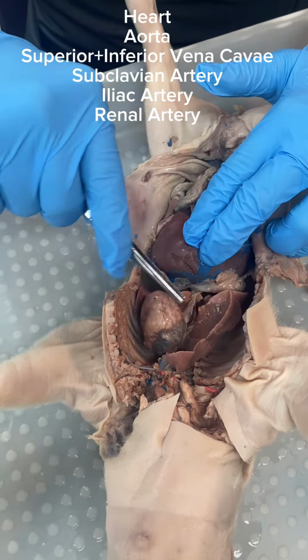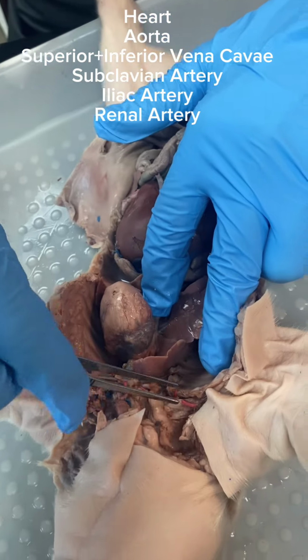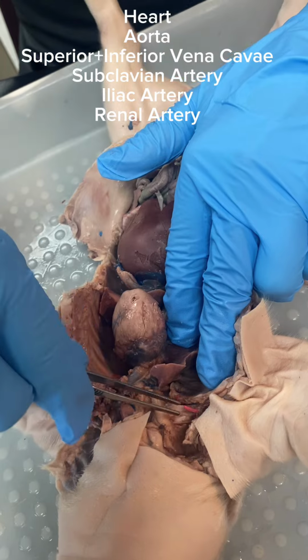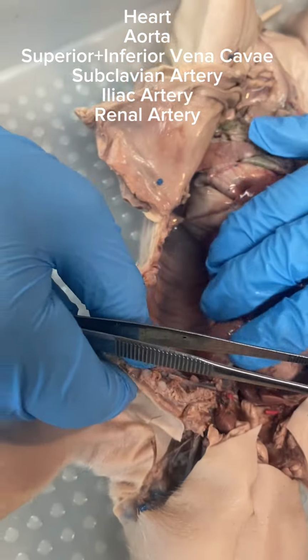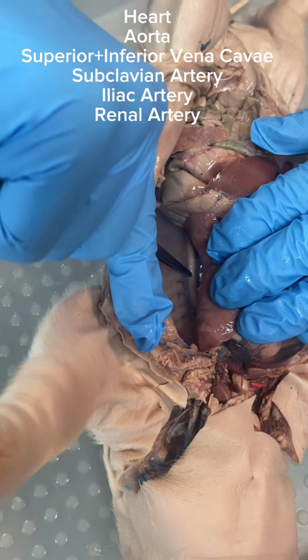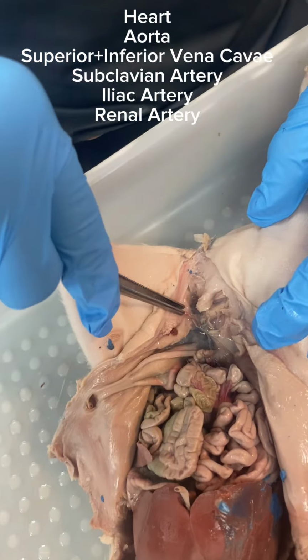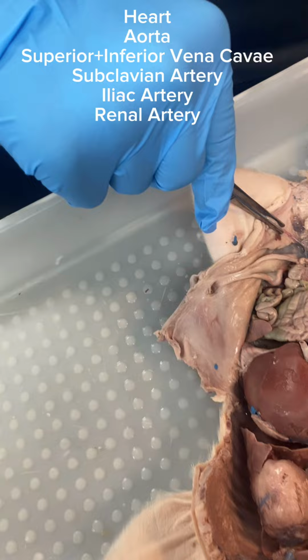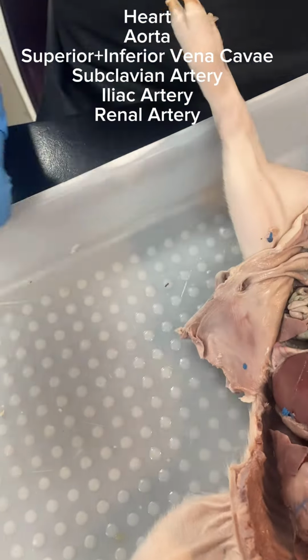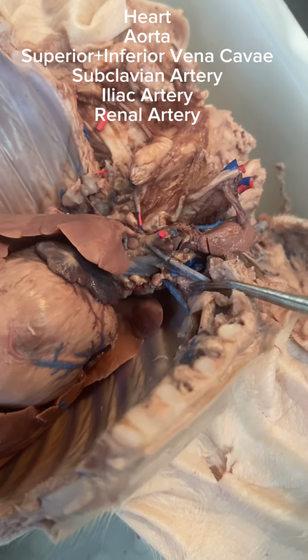This is the heart. This is the superior vena cava. This is the inferior vena cava. This is the subclavian artery. And this is the aorta. And this is the iliac artery. So that's the subclavian vein right there.